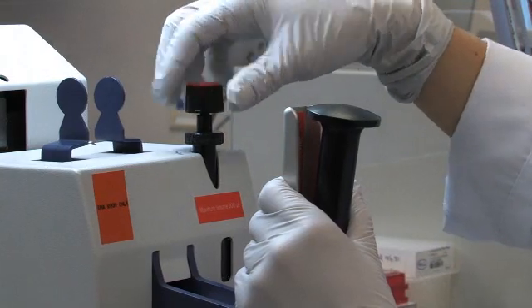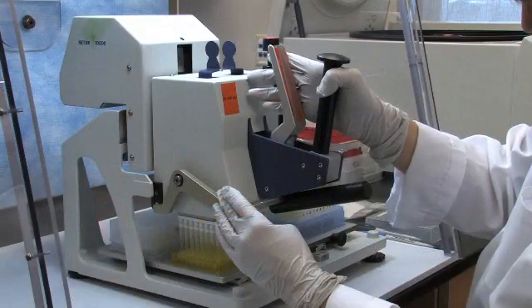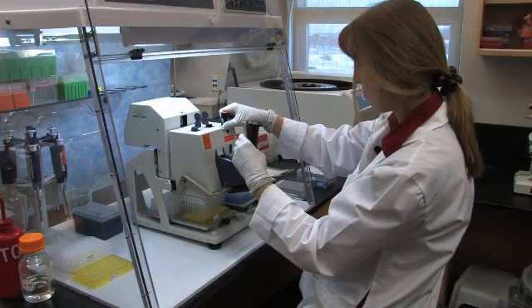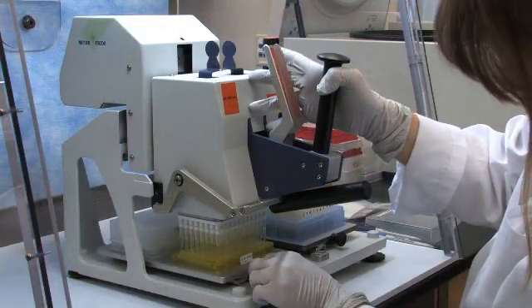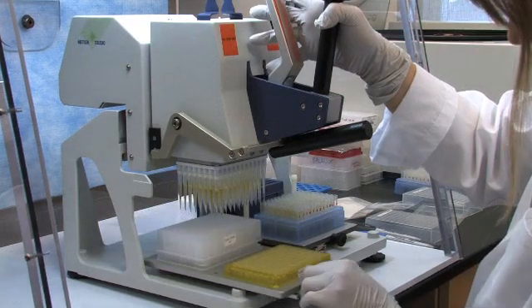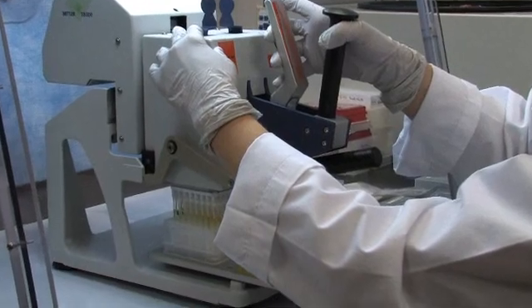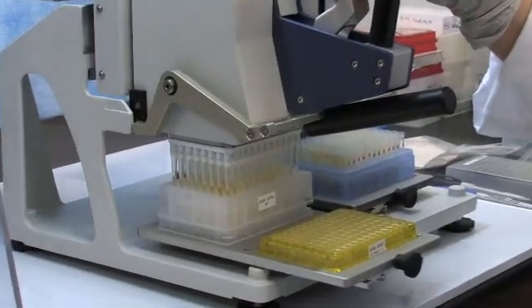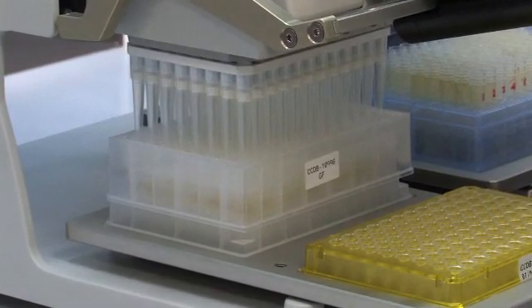The ability to change the volume in the middle of the sample processing steps is just one example of the liquidator's flexibility. After adjusting the volume to 150 microliters and, without touching off, 150 microliters of sample is transferred to the 96-well DNA extraction plate with the glass fiber membrane on the bottom. The liquidator's four working platforms are ideal for moving back and forth among various sample preparation processes.